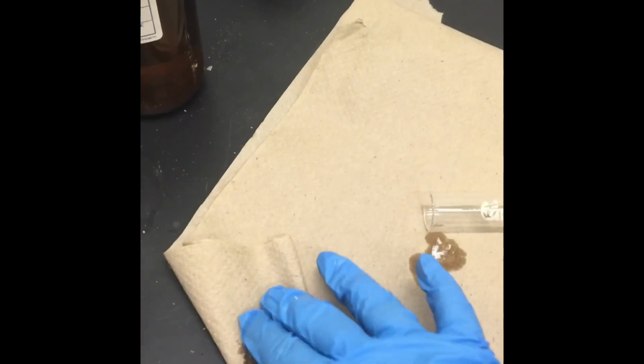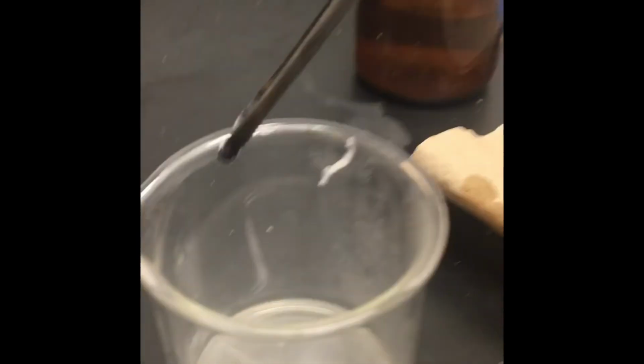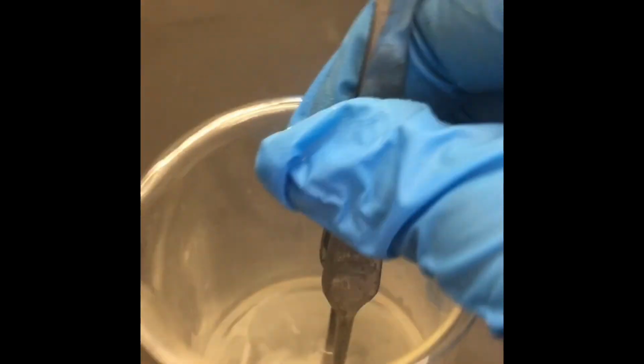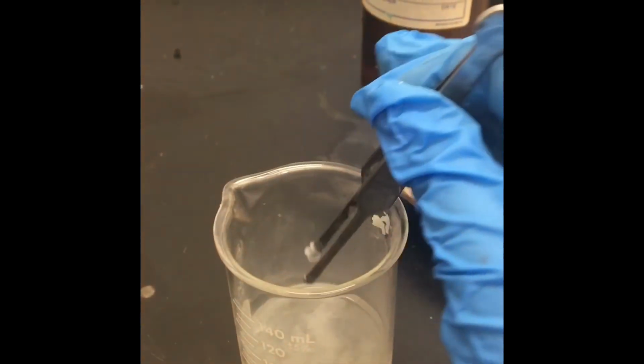And you can see that I will dry it. Technically, what we can do is dry it and then check the properties to see if it's fragile or if it's strong. Of course, then this is actually going to be strung into ropes, and it's going to take a rope shape, and then it's going to look even stronger. But you can see that I still have some. I actually want you guys to see how it forms here, which is pretty cool. Okay, so now you can see that we made a polymer.